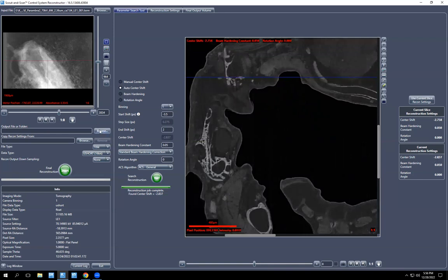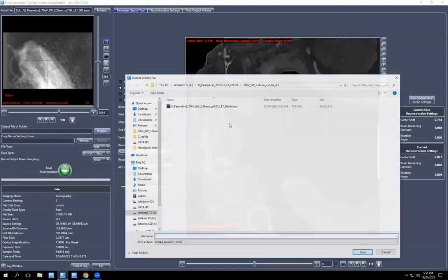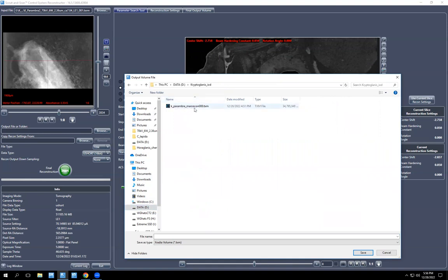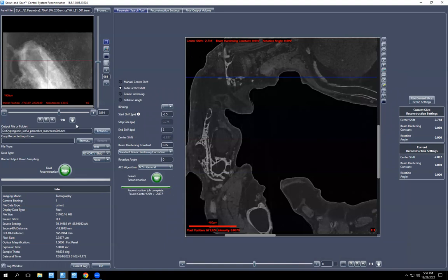Real quick, you have to save, you have to tell it what to name it and save it somewhere. So I've made a folder on this data drive called Kryptoglanis iodine. I already have this one, so I'm gonna name it the same, but this is the second segment. Click save. You have to save to the computer. I'm pretty sure you can't save to a hard drive. I think it will fail. So if you had chosen a hard drive as your location, I think the reconstruction automatically fails. We're not going to do any of that. We are going to drag down to the otoliths and then show how to do byte scaling.